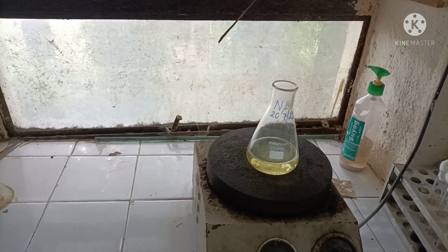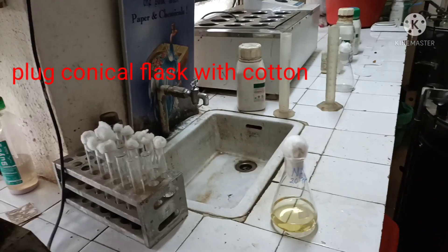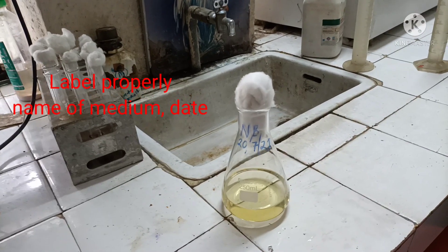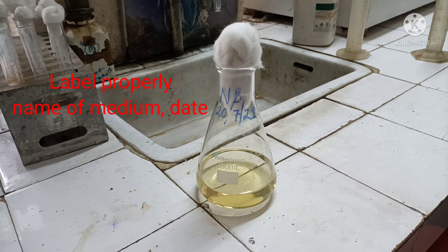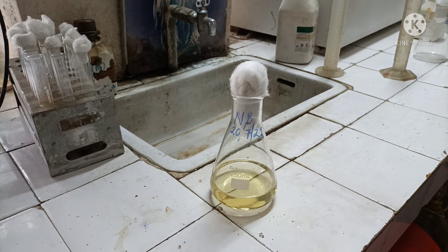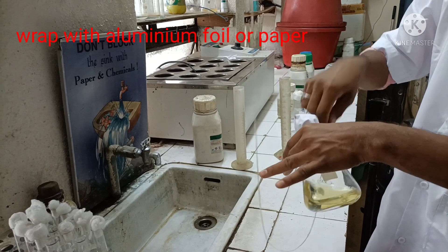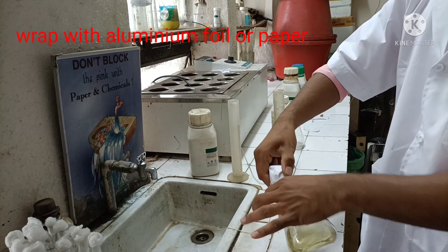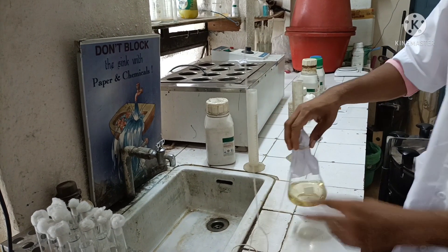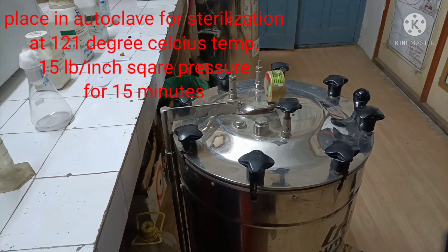The conical flask is plugged with cotton and labeled with the name of the culture medium and the date. We can also mention the class — labeling is very essential. Then we wrap the conical flask with aluminum foil and place it into the autoclave for sterilization.